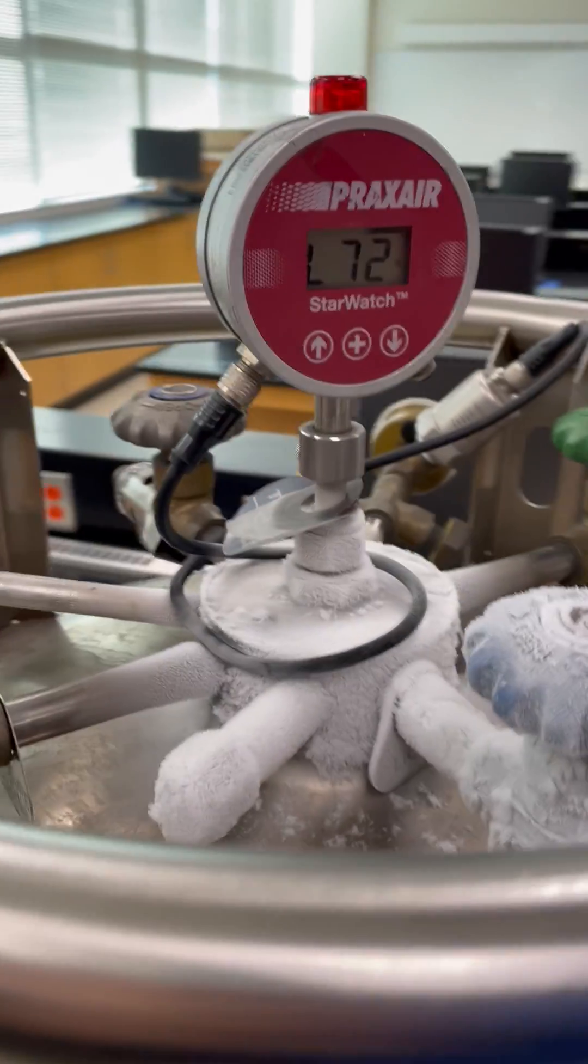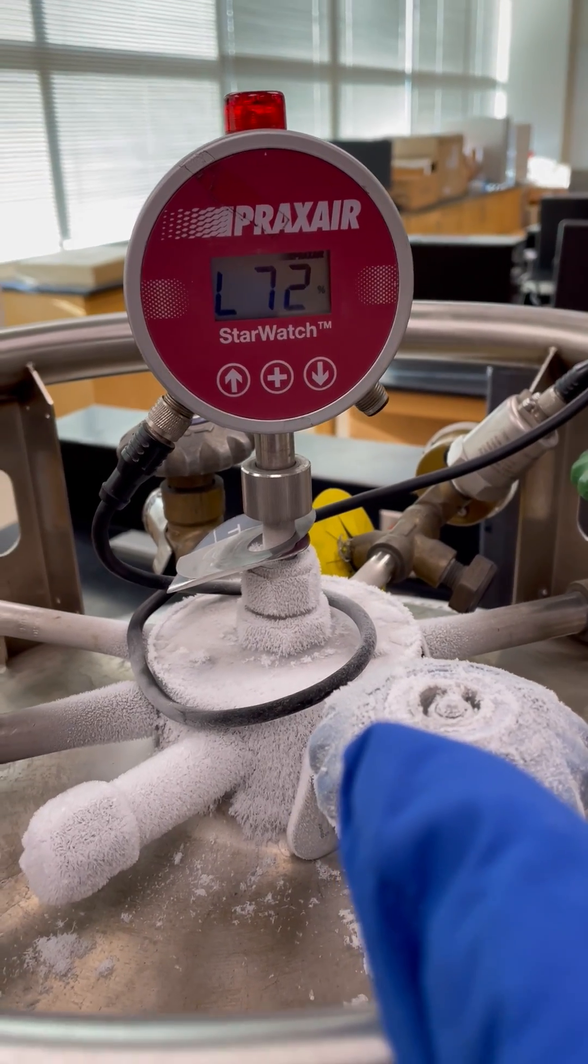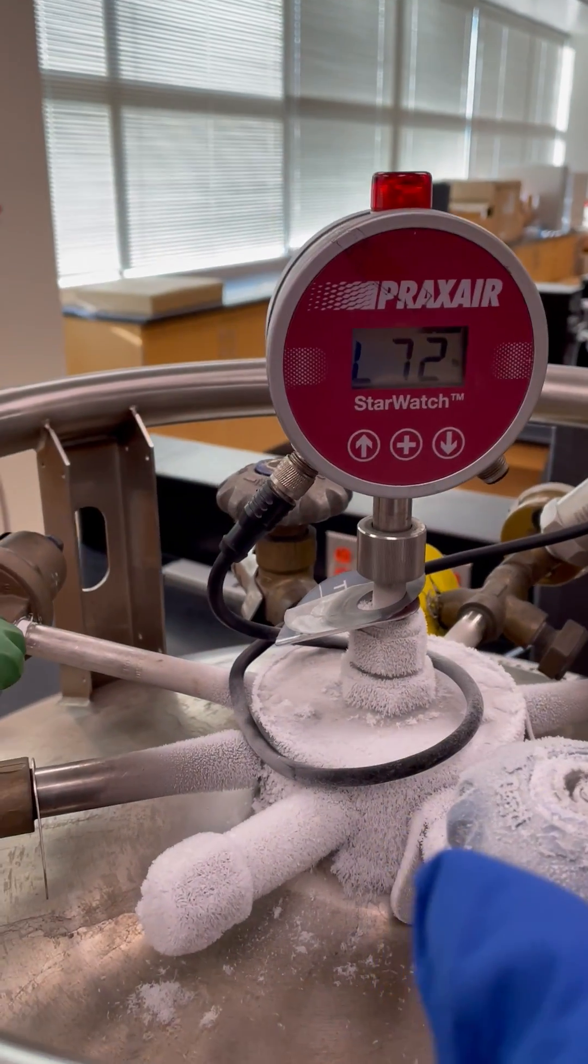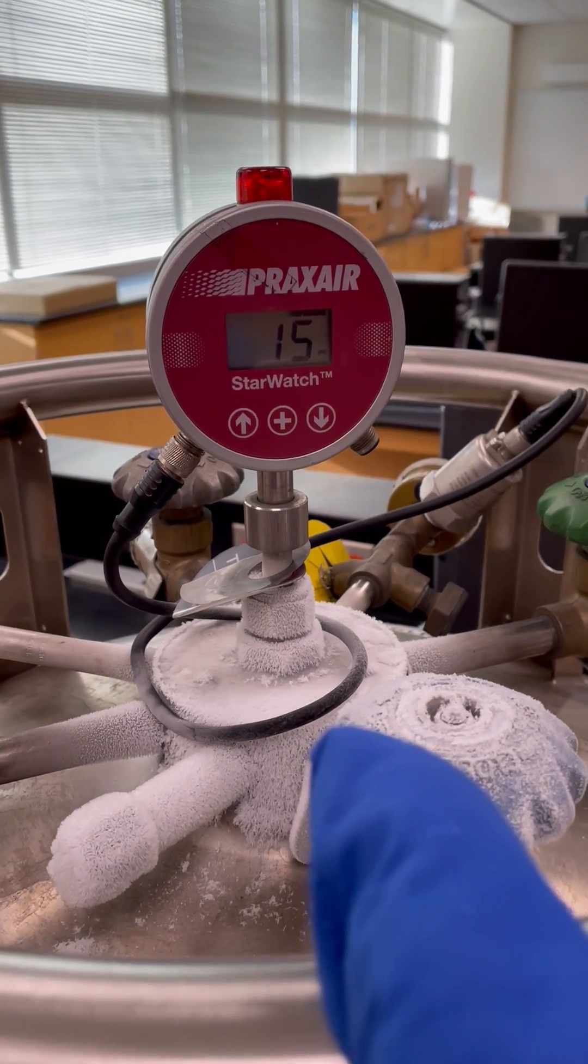For this rating, it's a little bit lower, and I don't know why. But now we have transferred about 28%. It is more than what I expect, because we have used it before, and it dropped to about 15 psi.